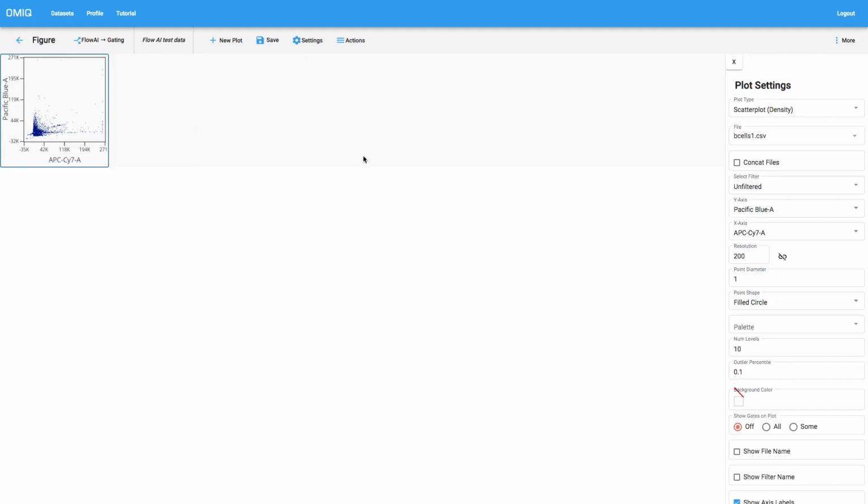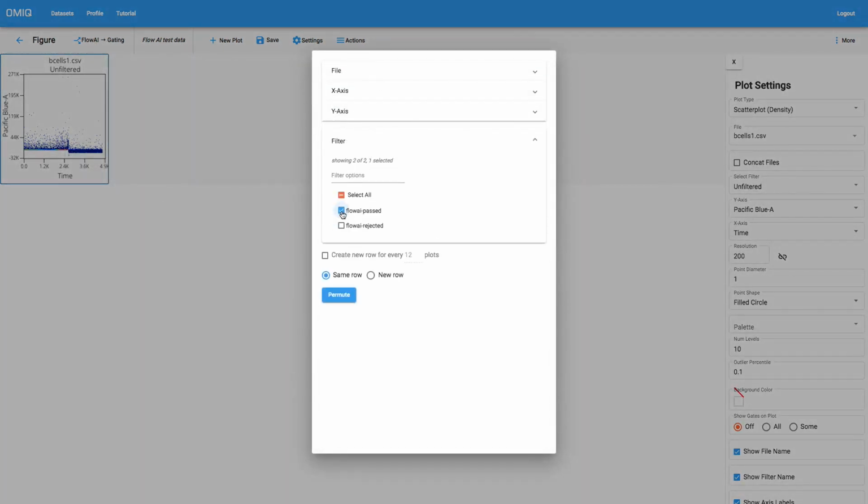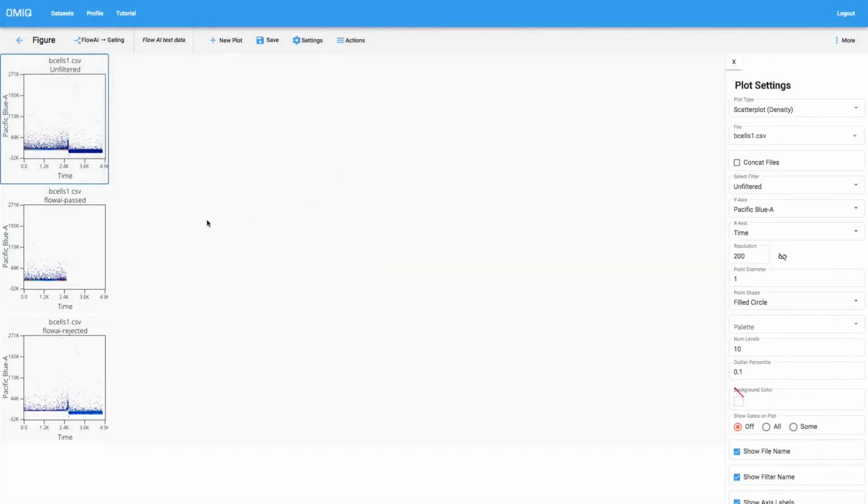The first thing that we'll want to do is set the x-axis to time, which is what we did earlier. And for helping us evaluate these, I'll also turn on the file names and the filter names. So the first thing that I want to do is evaluate the difference between unfiltered, and I'll permute these to also look at flowai-passed and flowai rejected. And I'll put these in new rows. And so now what we're looking at in the top is our raw unfiltered data. This is the events that flowai decided were clean and passed on to the rest of our analysis. And then here's the events that flowai rejected.